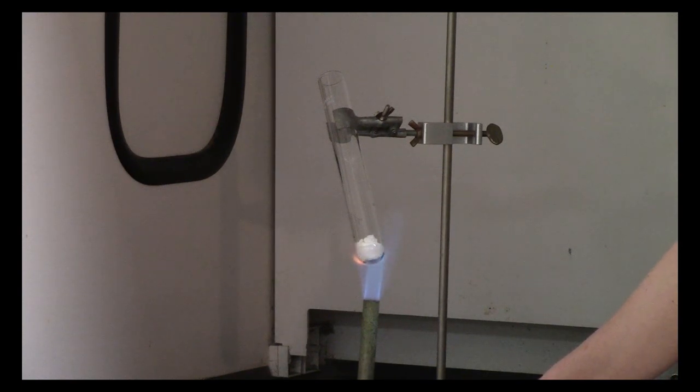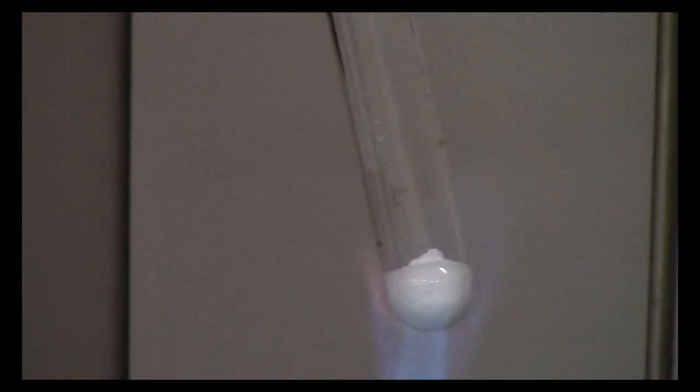So as I'm gently warming this, I'm starting to see the white solid liquefy a little bit. And you can see it collapsing just a little bit. I'm going to get some of my gummy bear friends ready. And then when it's all molten, I'm actually going to turn my gas off. And here we go.